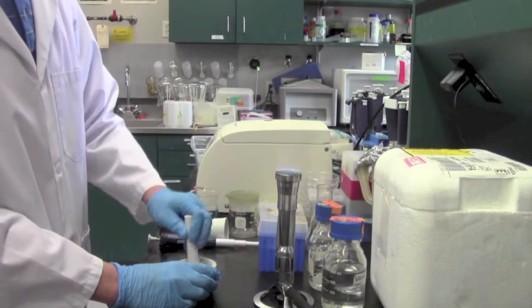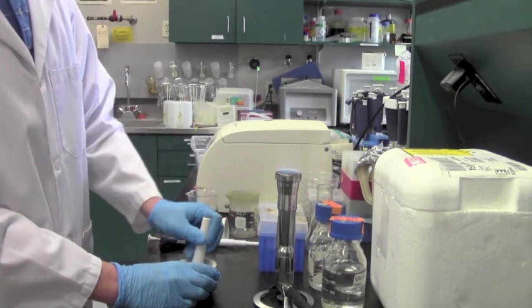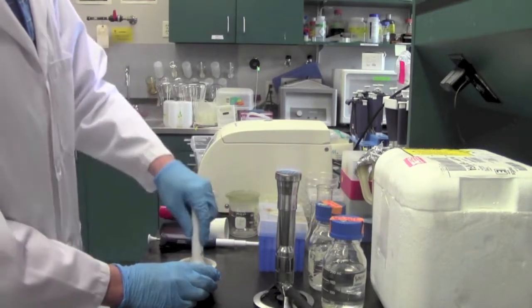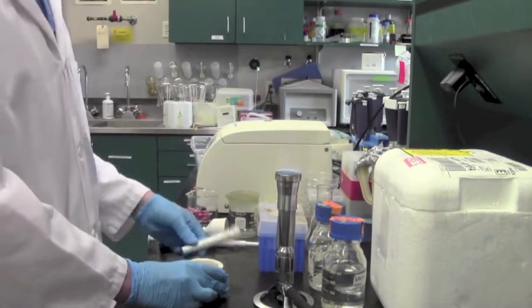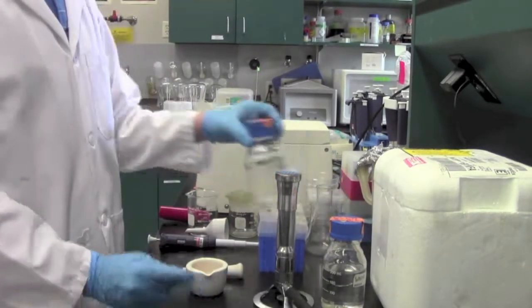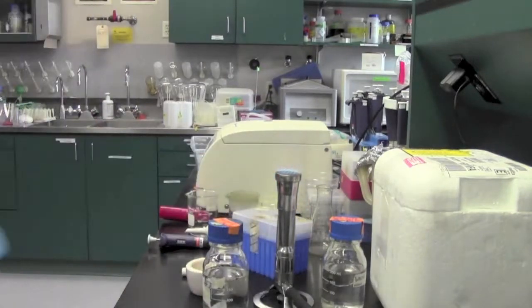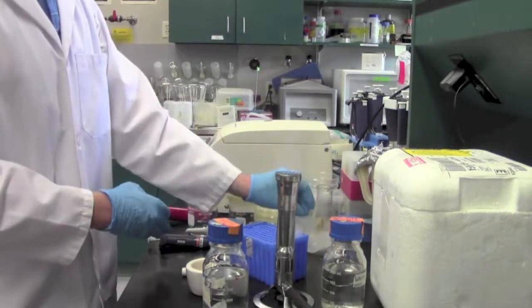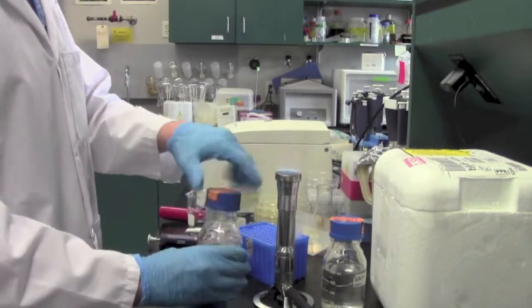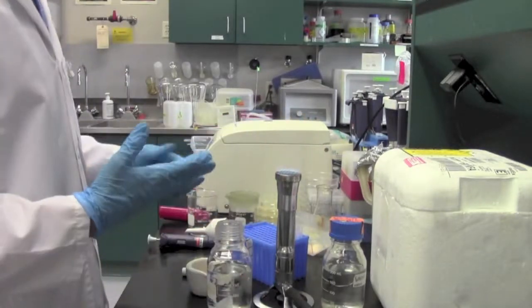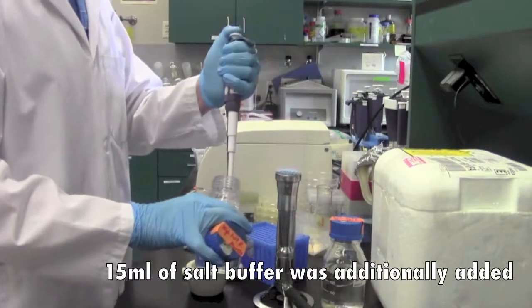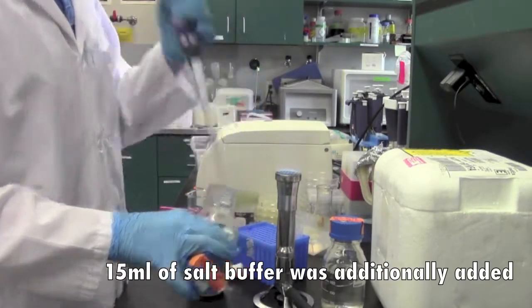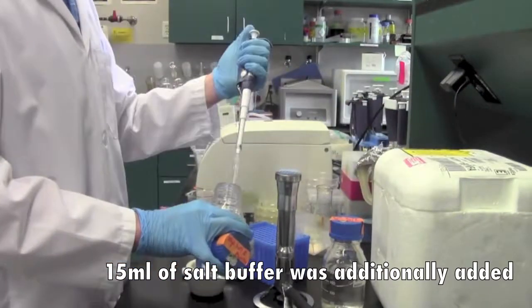So here I'm using a pestle and mortar to grind up the chicken sample. So here I'm adding an additional 15 milliliters of salt buffer to the mixture.